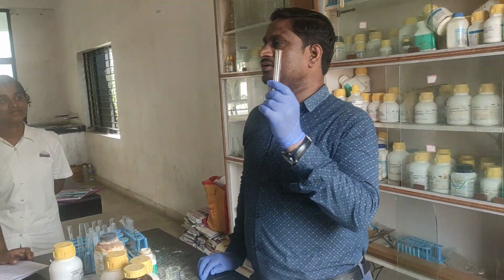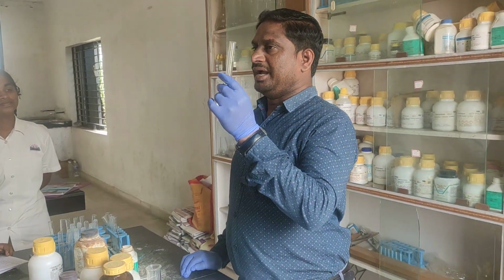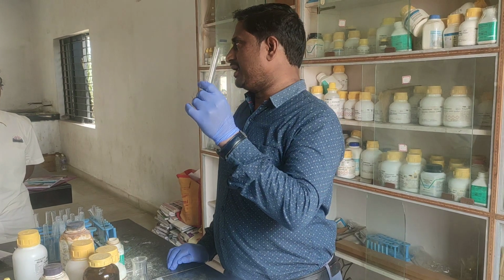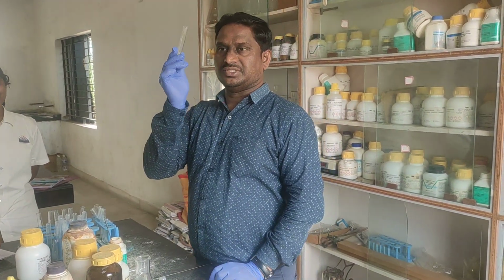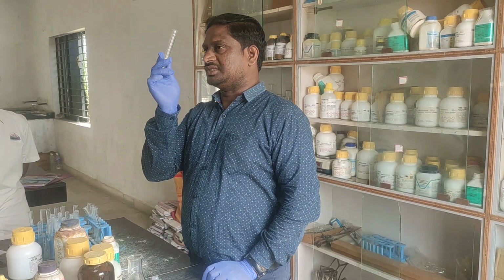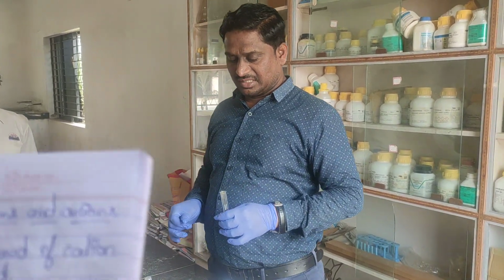So today we are going to perform cation and anion tests. First, this is what we call a test tube. So first I will take the given salt.